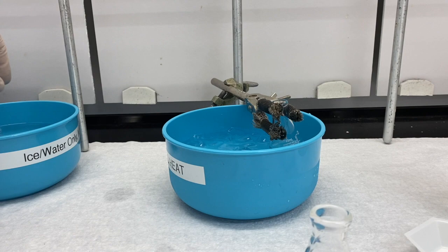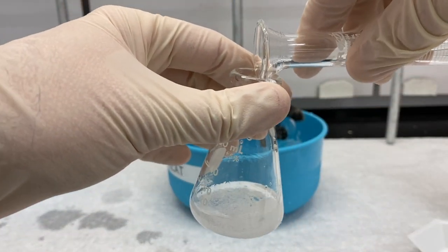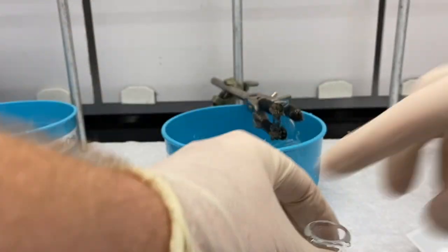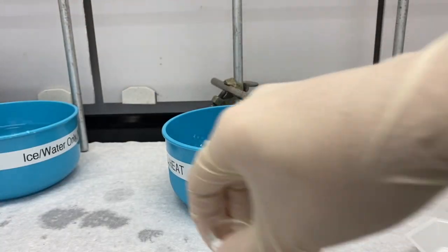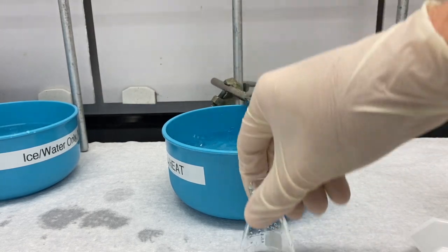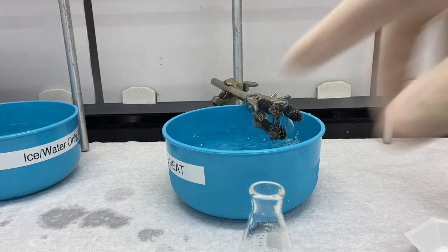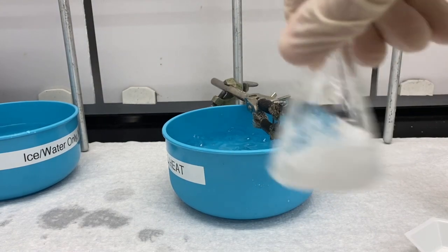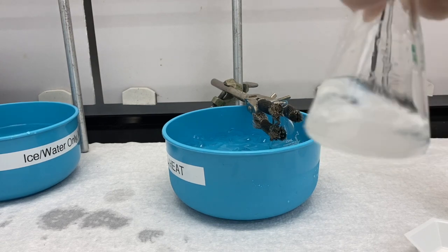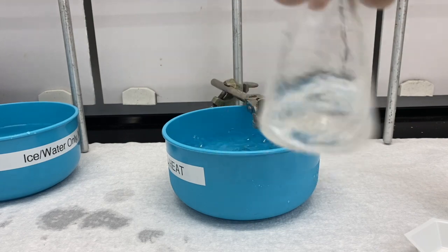And then I'm going to add my propionic acid. I'm going to give this a swirl. I'm going to try to give it a swirl, get it to break up. And then we're going to cool it in the ice bath so we can add the sulfuric acid.